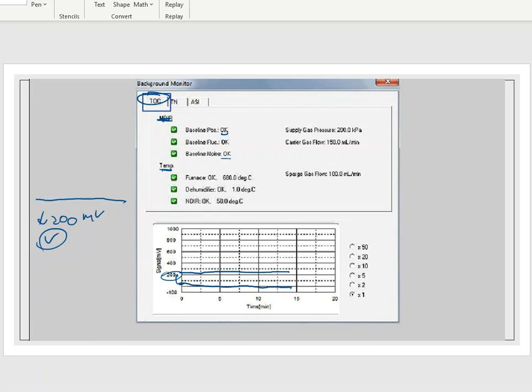So you would have to readjust the baseline. You would double check your NDIR, and you would readjust the baseline to get it back down to 0 whenever possible. Okay, so that's the issue with the detector, and that could be an error code that you're going to get, where it says you're never ready, you're never ready, you're never ready. One of these boxes will be bad. X, you can't do anything at all, and that could simply be due to the fact that you have an elevated baseline in your detector, and it needs to be reset, or it needs to be fine-tuned, or you need a whole new detector in order for this thing to work.